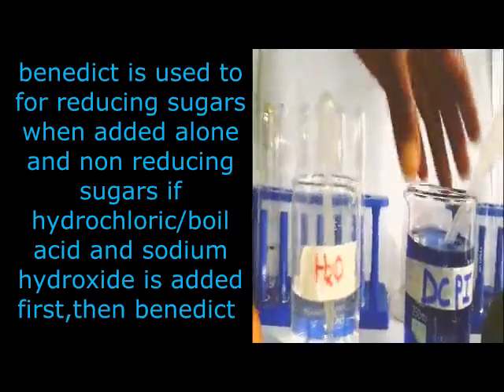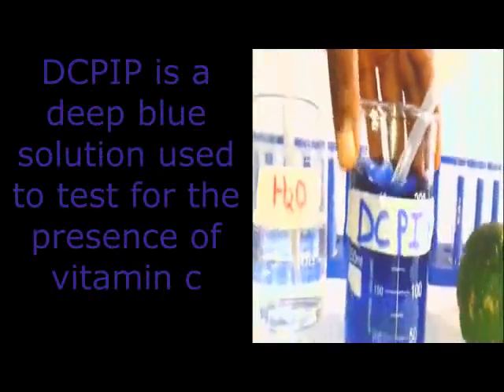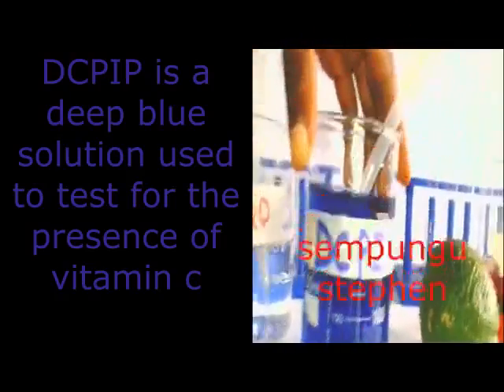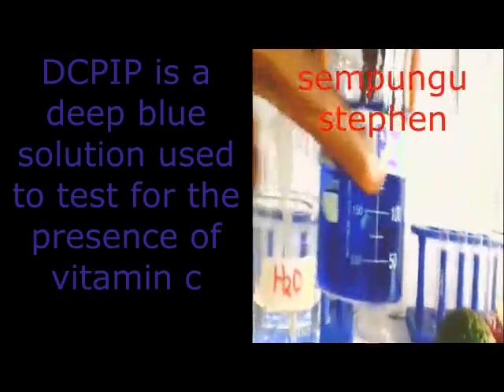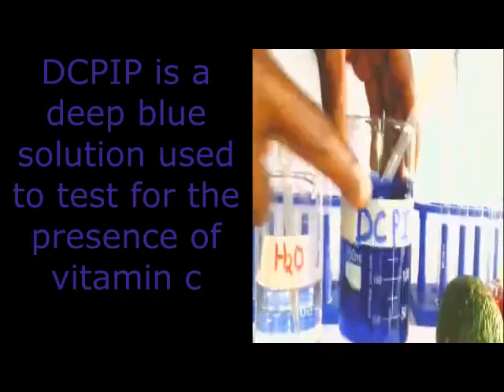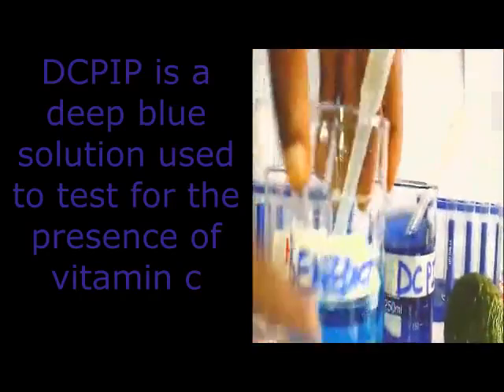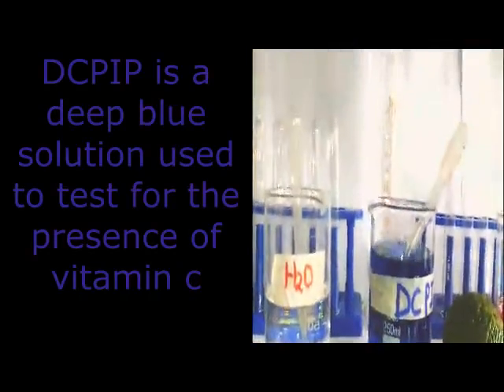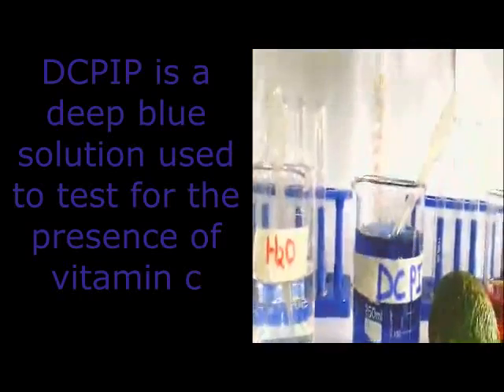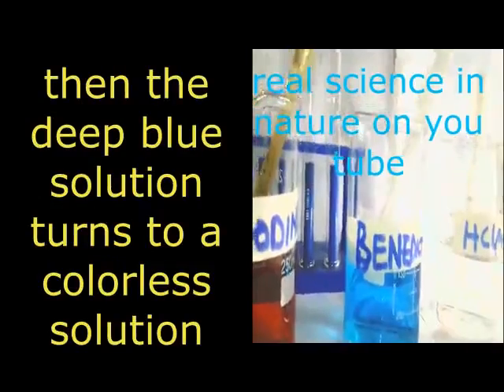Another crucial reagent: most of you enjoy vitamins. One of the vitamins which is important in our body is vitamin C, like in oranges and pineapples. So we have what we call DCP-IP. You can see that this one is a deep blue. When you compare the blue of Benedict with the blue of DCP-IP, you will discover this is the deep blue, and this one is just pale blue.